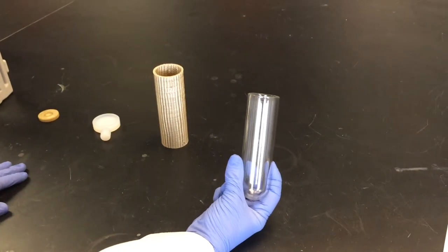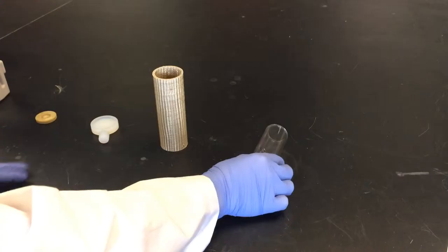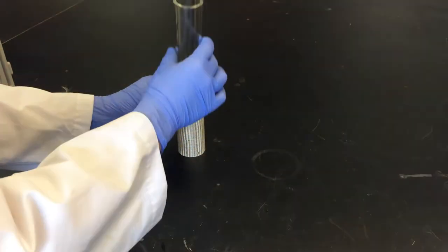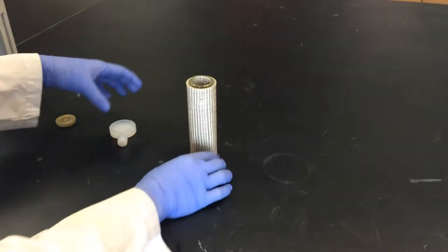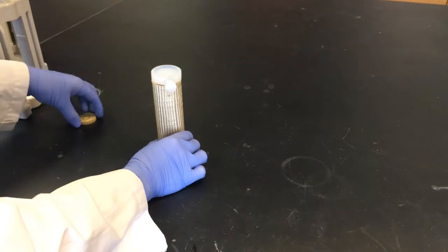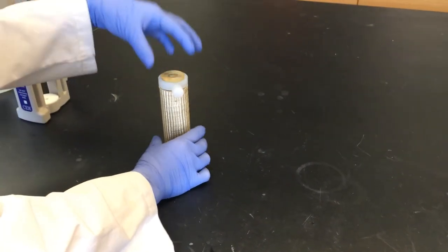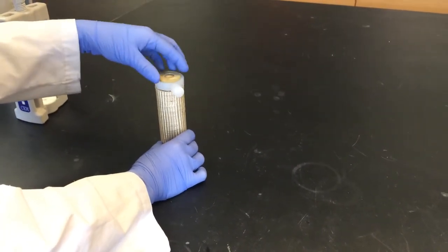This is the glass tube that you load your reaction into. This is the jacket that the tube goes into. Here is one of the caps and the second cap. Neither of these caps screw on or click, they're both just loose.